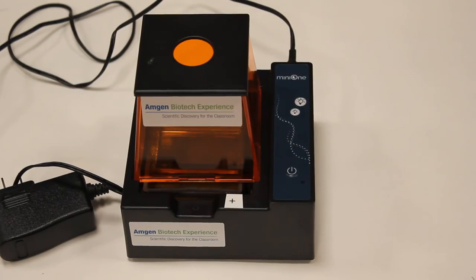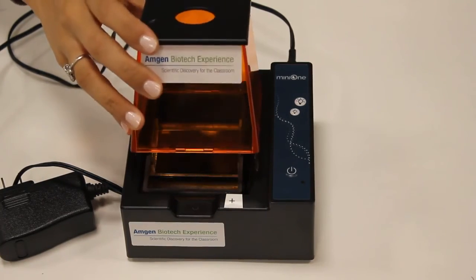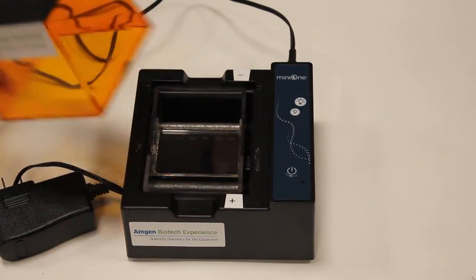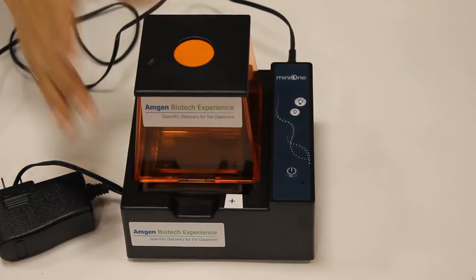Students may play with it and take off the hood. Remind them to replace the top and turn the gel box back on.